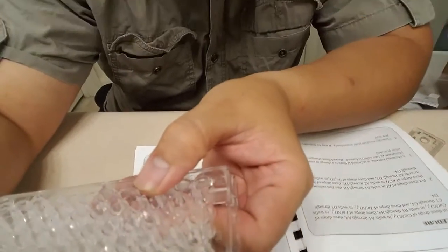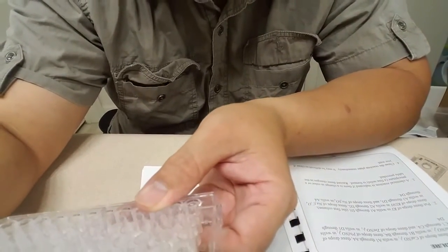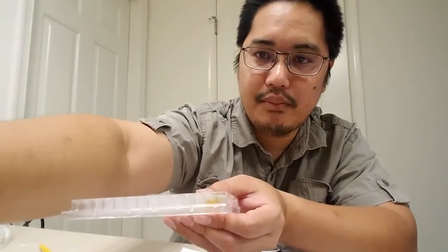But when I put the potassium iodide in there, you can immediately tell that it changed from blue to a different color. That means a reaction took place, and that's all you need to do. If you see a precipitate or some kind of reaction or change of color, that's when you know a reaction has taken place.